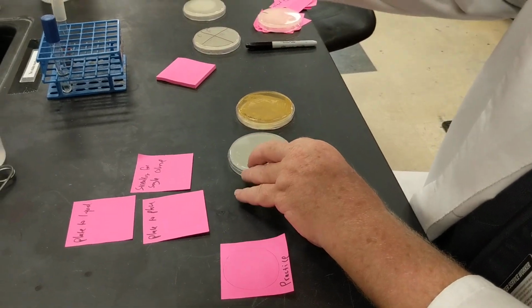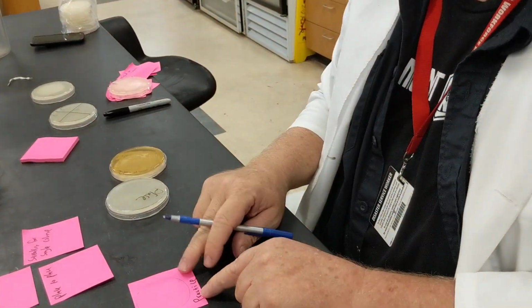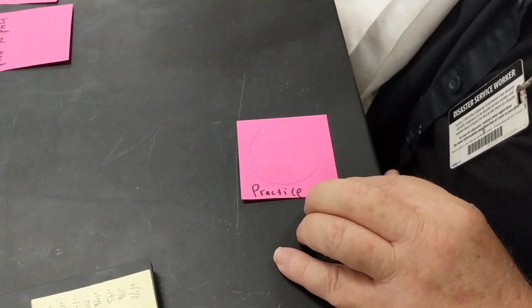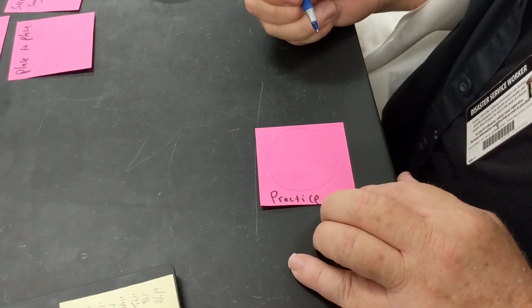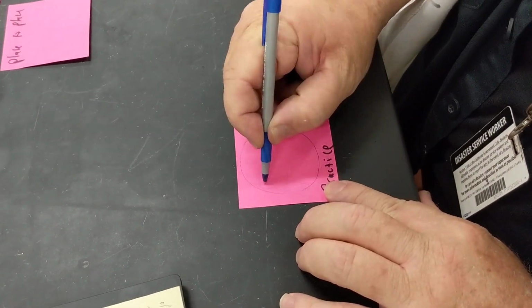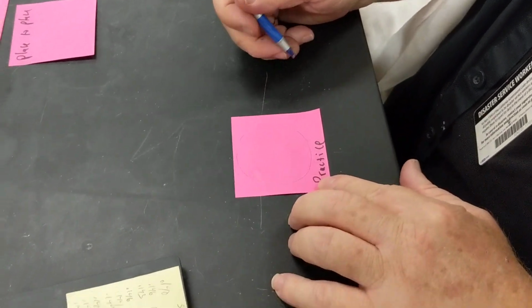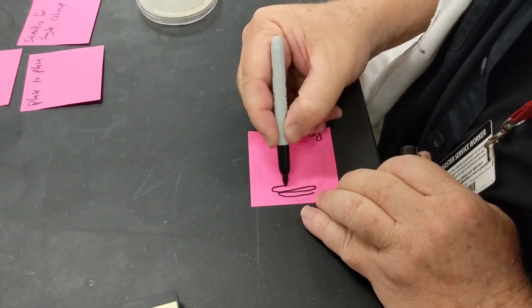To give that pattern to you again, what I may have you do in class to practice is basically, so here's practice. I got my little practice thing. What I'm going to have you do is pretend using a pen. So you're going to take some of your bacteria, you're going to make your initial inoculation just by doing a line. You're then going to rotate your plate 90 degrees. You flame your loop, and then you go back and basically you color it by going back and forth like that. And you can go a little bit more. I'm going to use a different pen. You then flame your loop. I will now go back and forth. You're going to go back and forth maybe about 3 or 4 times.